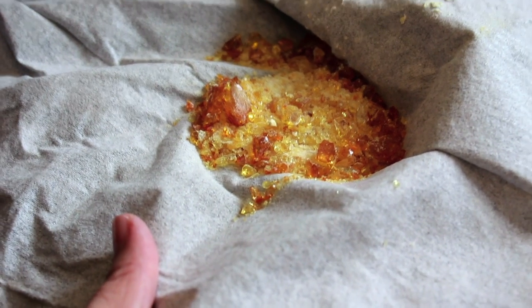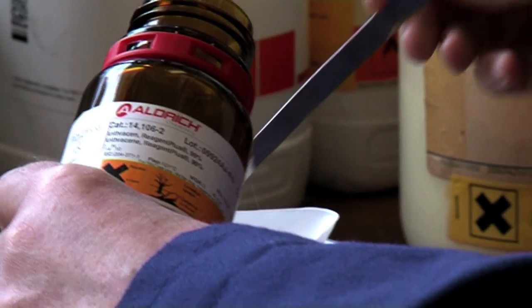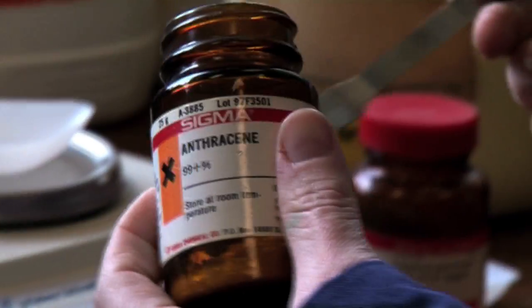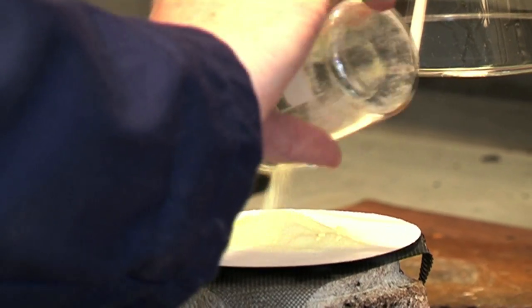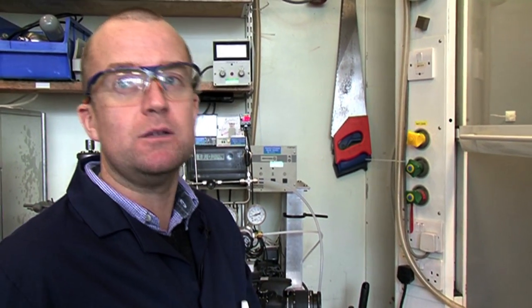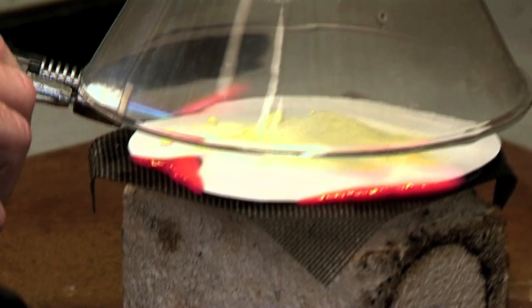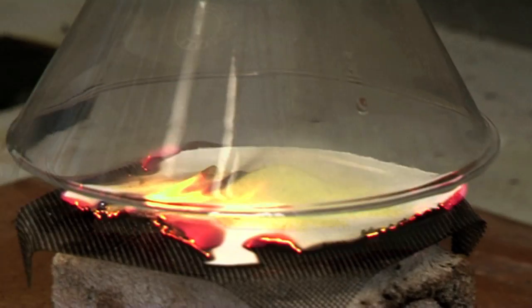Let's start with black smoke, an unsuccessful vote. We need some sulfur, some potassium perchlorate, and some anthracene. You can imagine we've counted up the ballots, we don't have a majority vote. We're going to burn off the ballots with our mixture of chemicals and tell the people waiting outside that we don't have a pope. Here it comes.